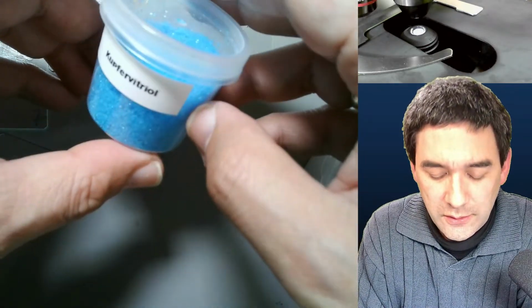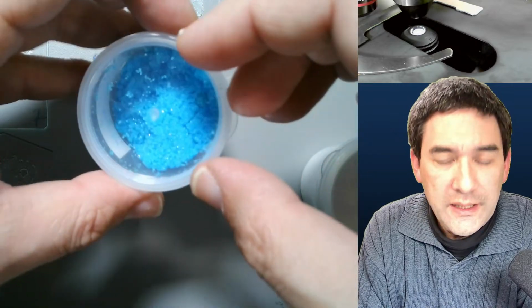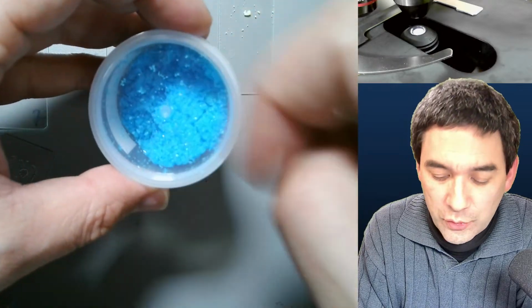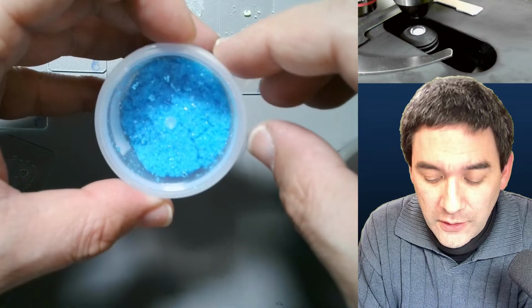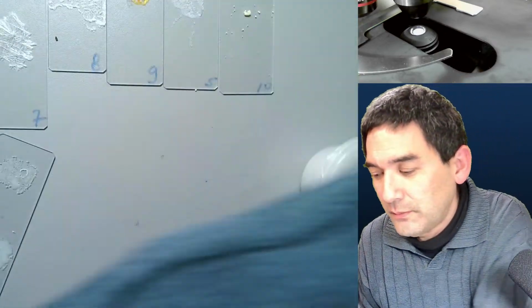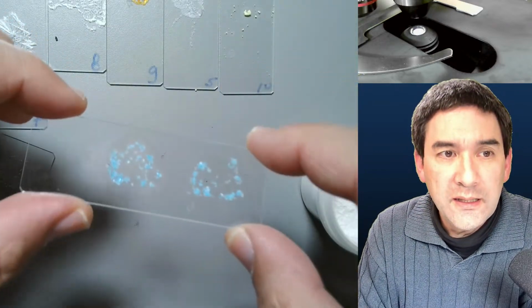Okay, nice blue color. And yeah, it's used for a variety of technical reasons. But what I read is you should not dump it down the drain because water microorganisms really don't like the copper. Of course, some of you might know that copper and other metals are indeed not good for water microorganisms. That's one of the reasons apparently why there are copper coins, because microbes don't like to grow on copper so much. And I placed also some of this substance on a slide and allowed it to dry.